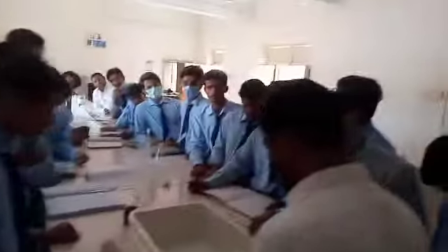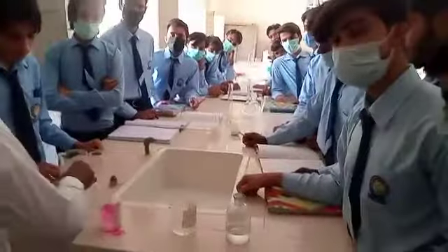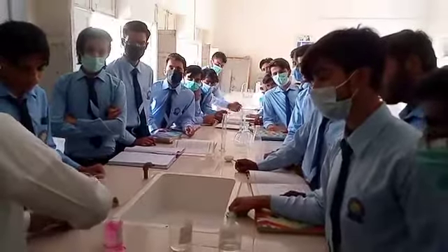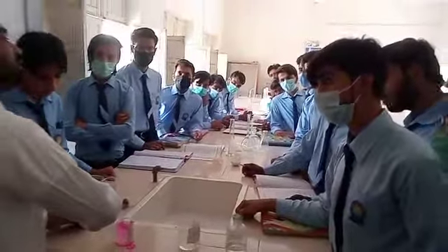The indicator is used to find out the end point of the reaction.